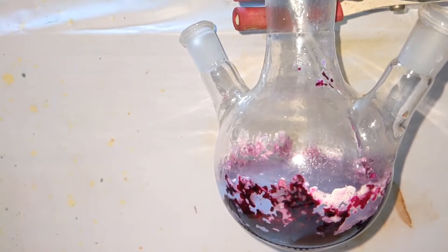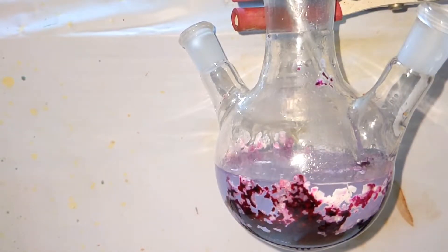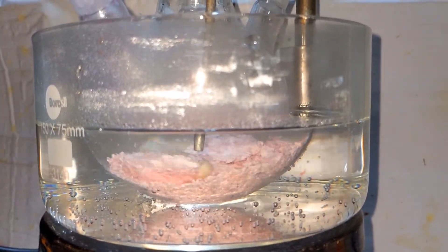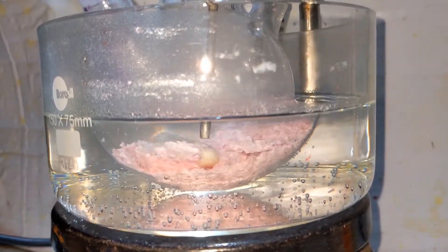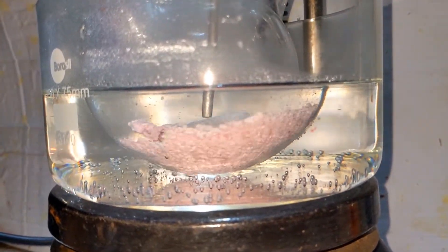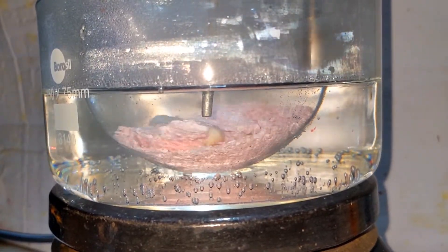Next, we wash the flask with hot water to dissolve much of the sulfuric acid and unreacted phthalic anhydride. This is not going to remove the thymol easily. The method I found helpful to remove the thymol is placing the flask in a hot boiling water bath with around 100 milliliters of water inside the flask. It was stirred, and eventually most of the phthalic anhydride dissolved and thymol started to melt, as its melting point is around 50 degrees Celsius.